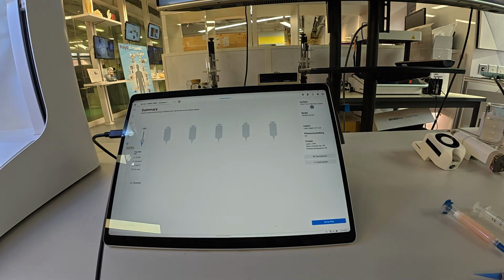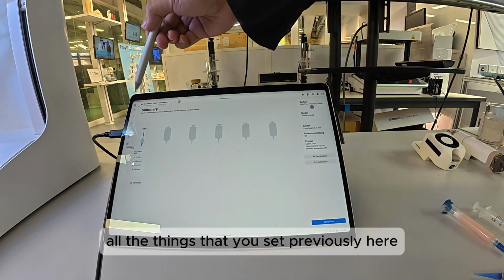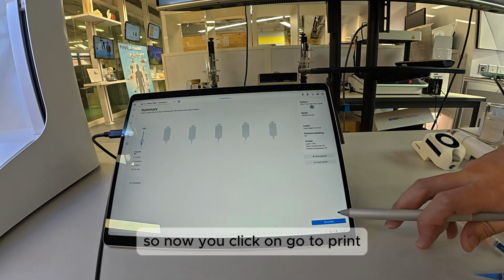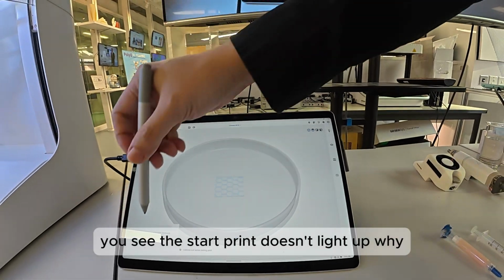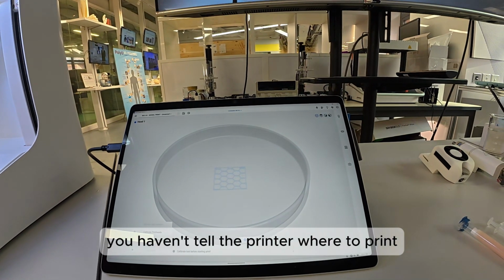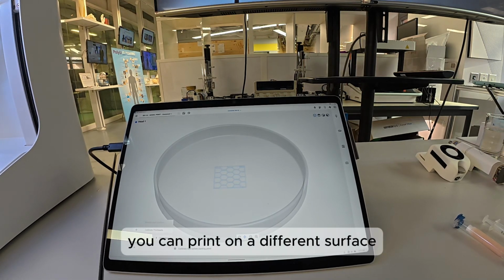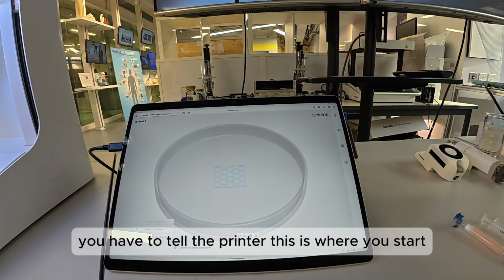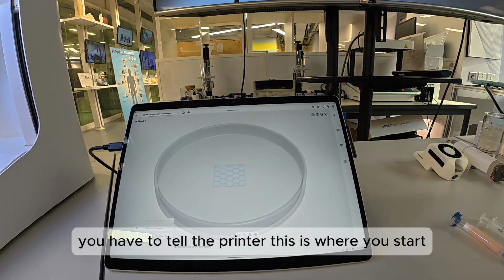And this is where the software shows you all the things that you set previously. So now you click on go to print. This is a start print. You see, the start print doesn't light up. Why? Because you haven't told the printer one thing. You haven't told the printer where to print. That's important. Remember, I told you you can print on a different surface. So some surface is tall, you have to tell the printer this is where you start. Some surface is lower, you have to tell the printer this is where you start.